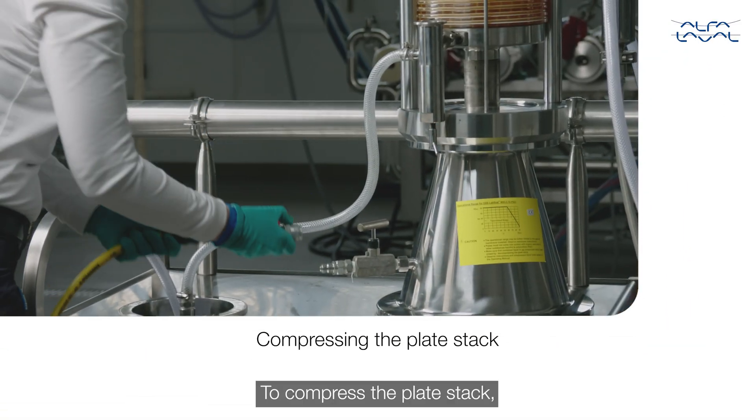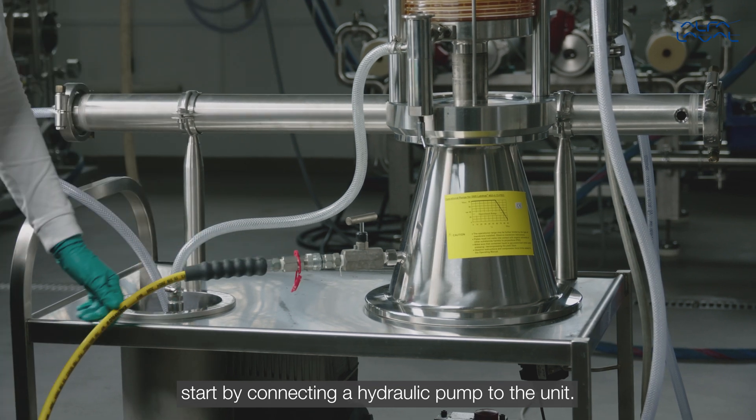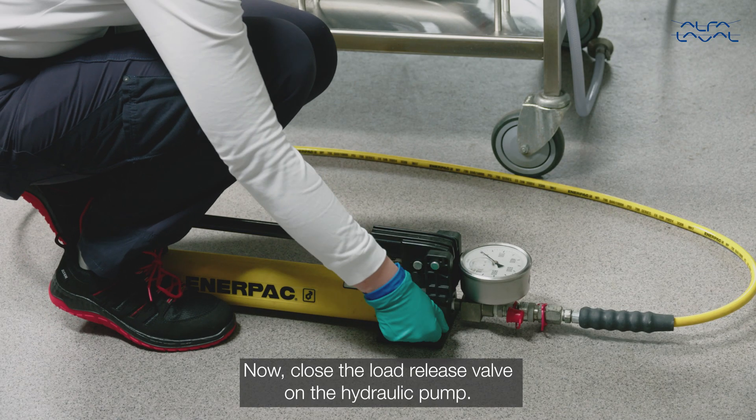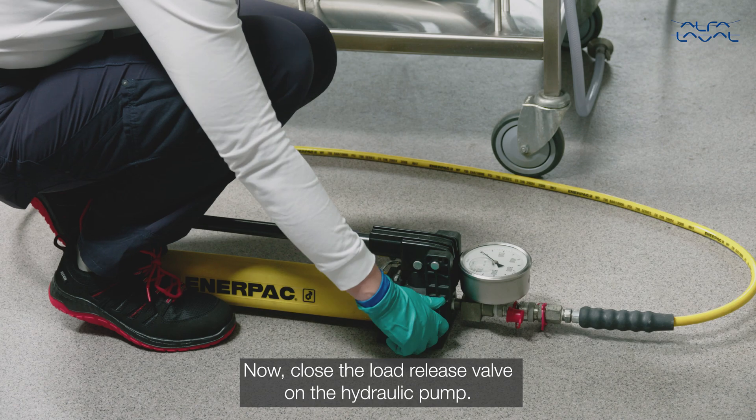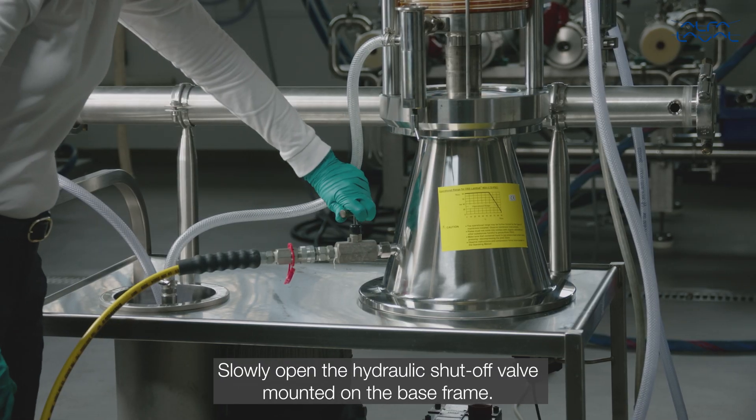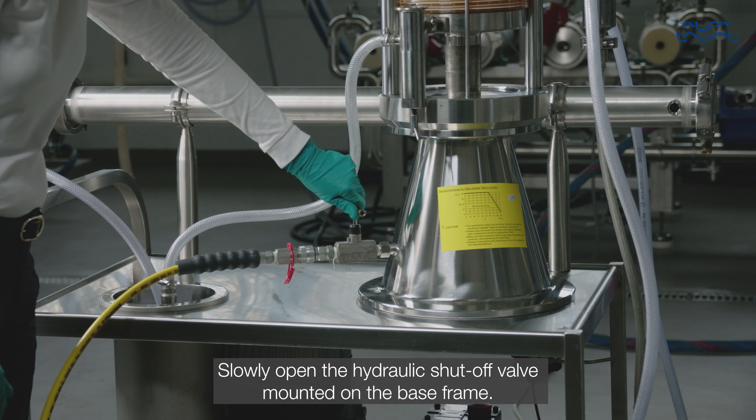To compress the plate stack, start by connecting a hydraulic pump to the unit. Now, close the load release valve on the hydraulic pump. Slowly open the hydraulic shutoff valve mounted on the base frame.